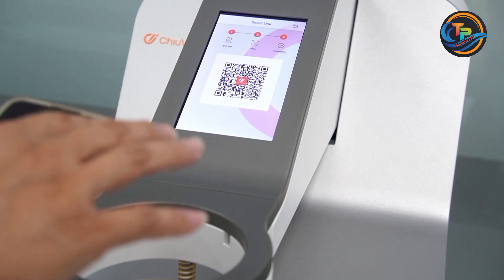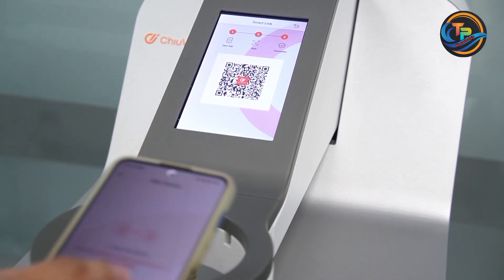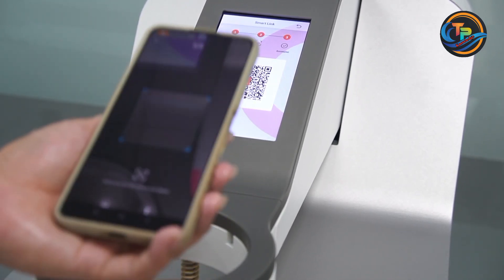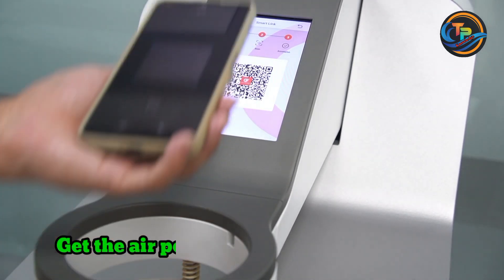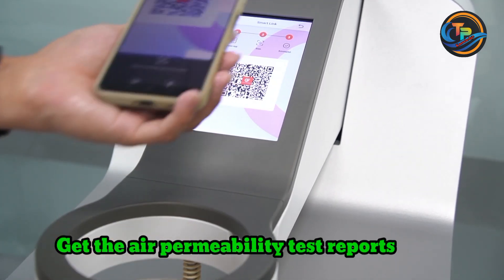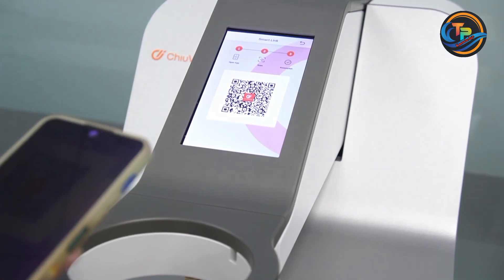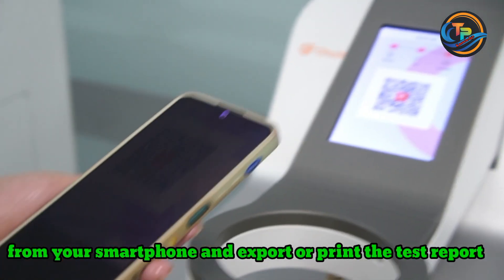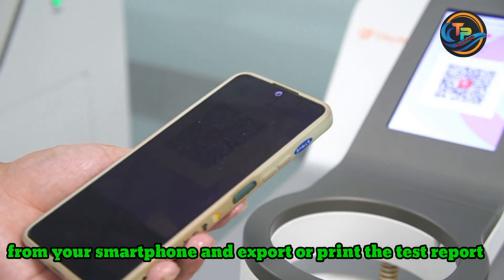Using this Air Permeability Tester, you can achieve real-time remote monitoring of test status, get the air permeability test reports from your smartphone, and export or print the test report.